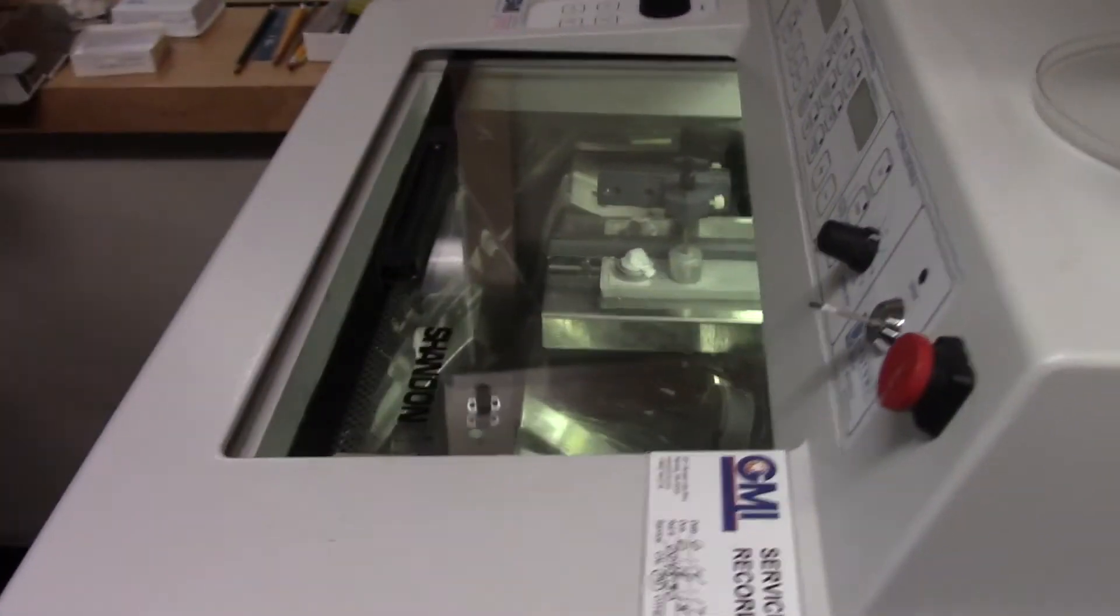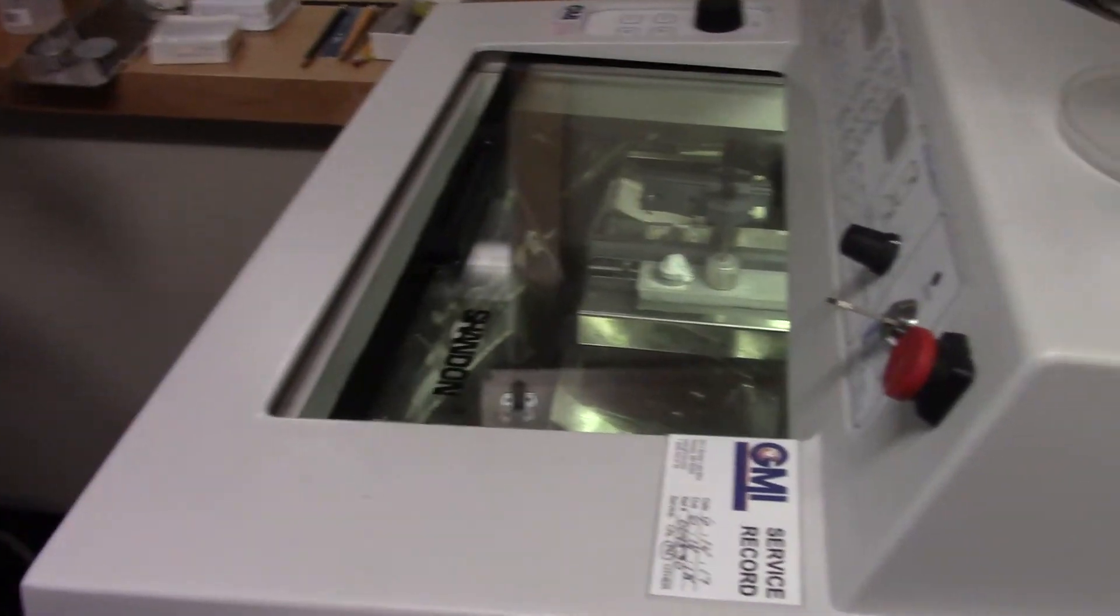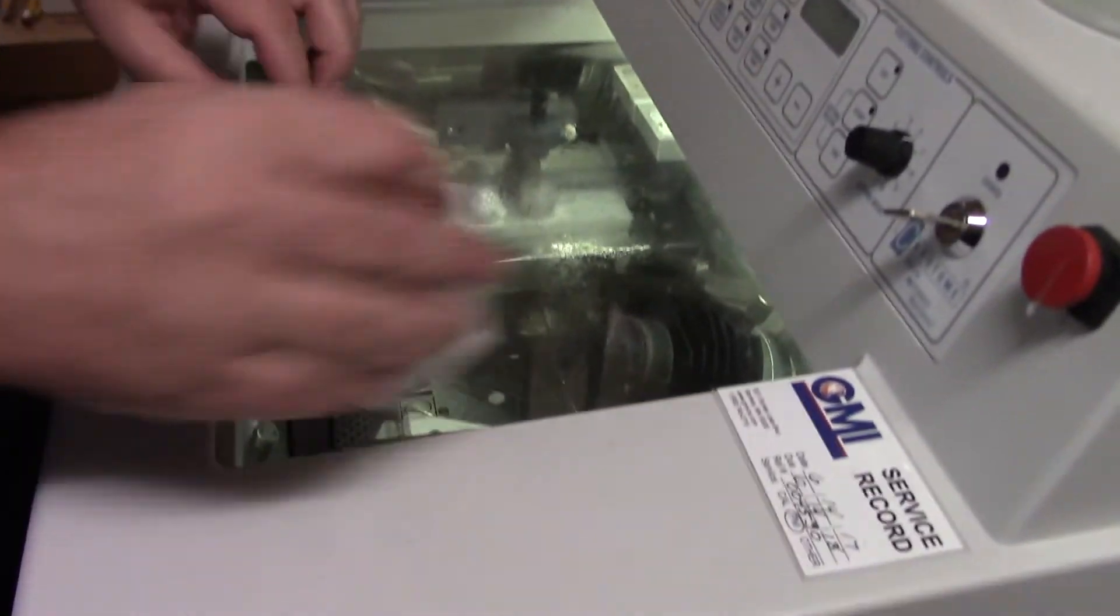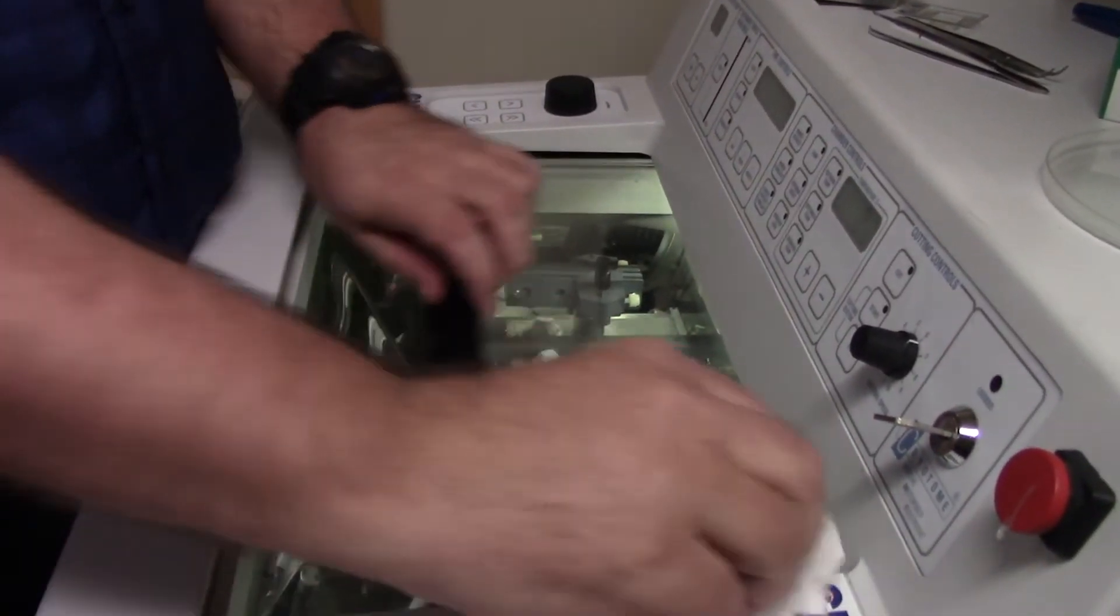I'm going to grab another paper towel. Oh, I got some kimwipes right here. So if I've got tissue like axolotl tissue that I've been cutting on here, I can clean all the different parts.